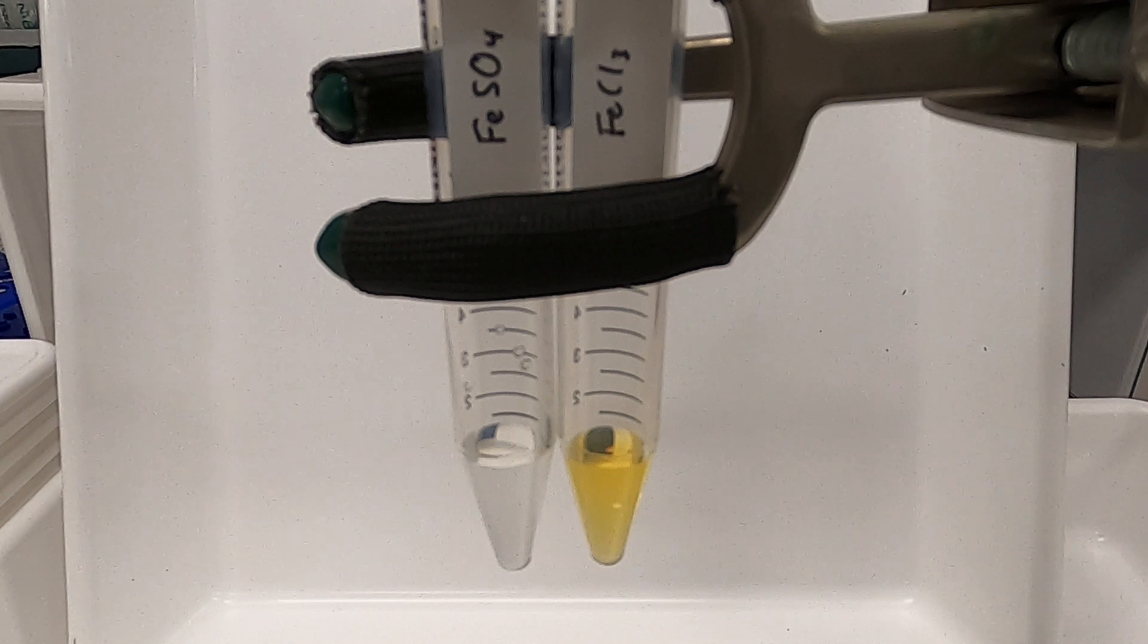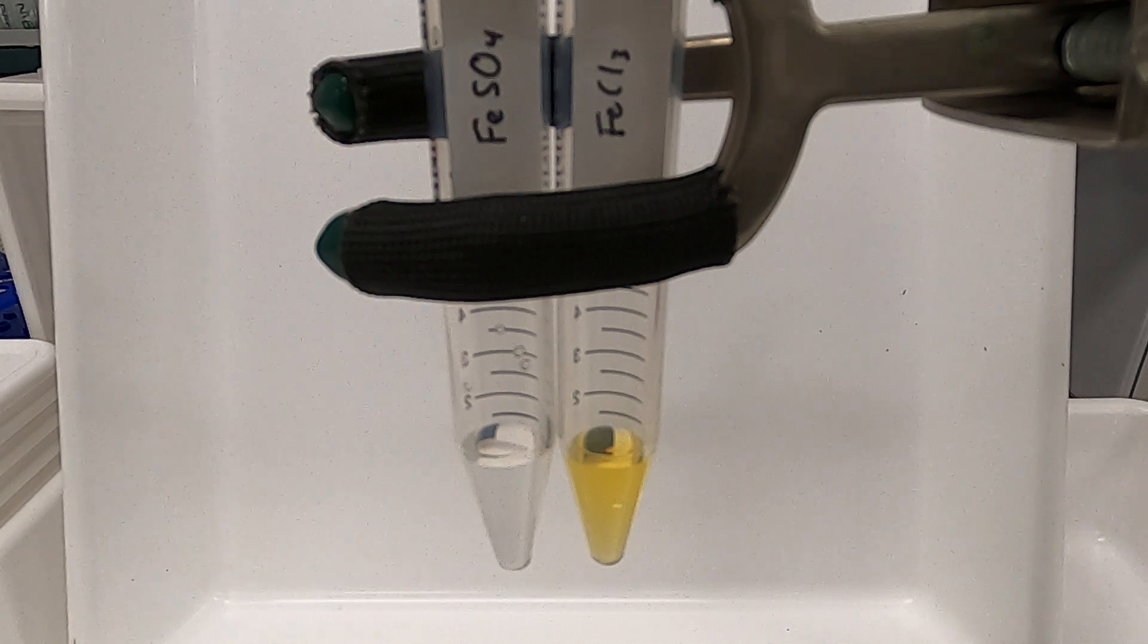So first thing to note about the solutions presently in the tubes, we can see that they are both clear. The one on the right however has color, but it still is clear which tells us that the contents are dissolved.